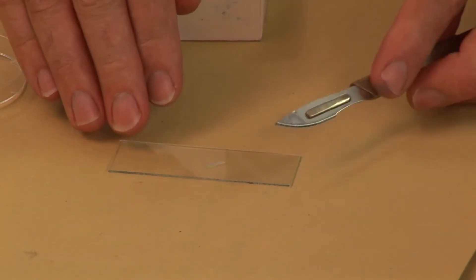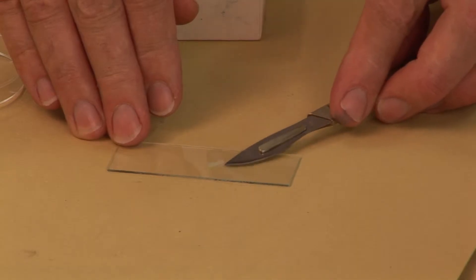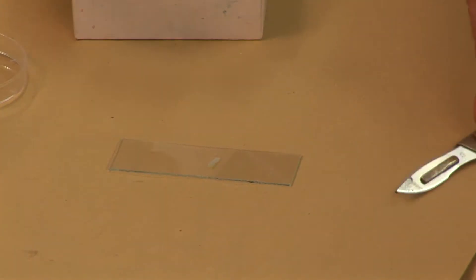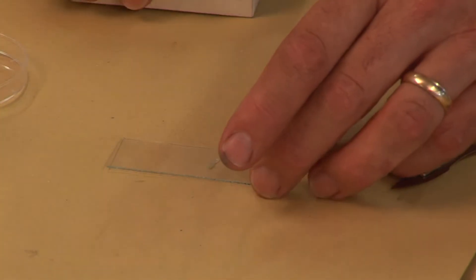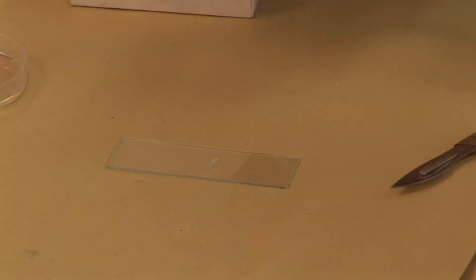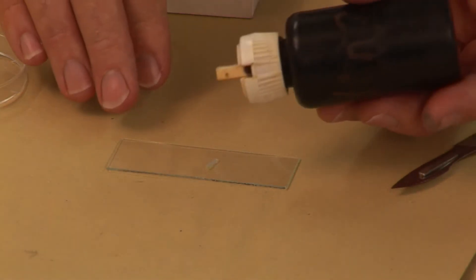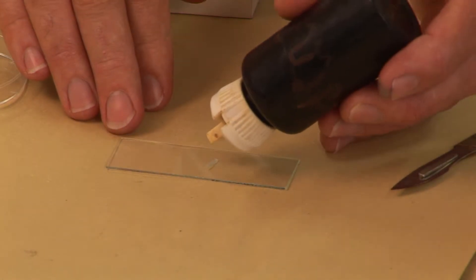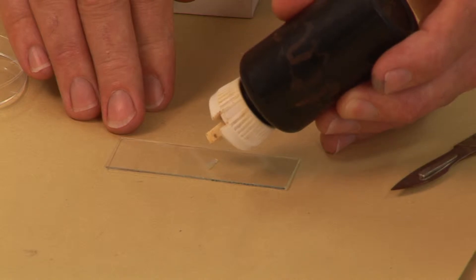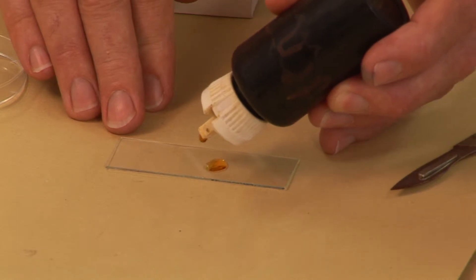Now because it's quite transparent, what I've got to do is put some colour stain on it. So what I'm going to use is iodine. All you do is place a couple of drops of iodine on top of the onion, like so.